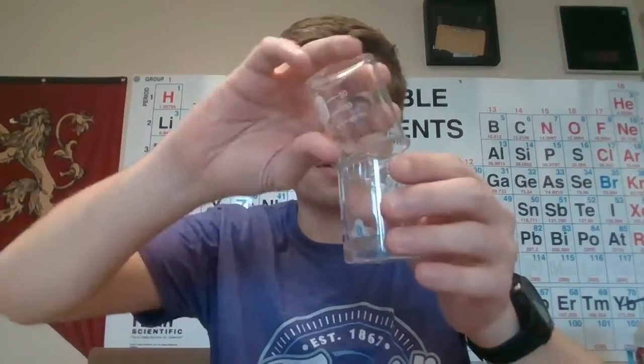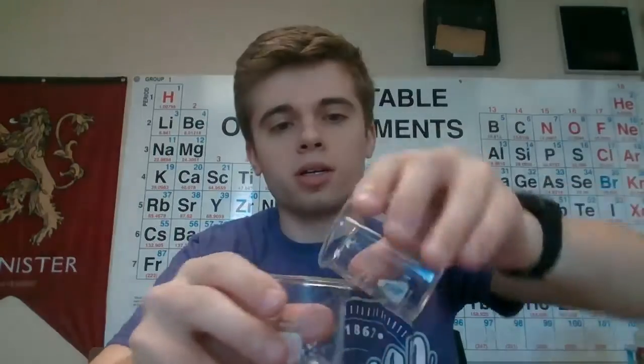Welcome back. We're going to do trial 3 now. This is at room temperature, which in here is right around 18 or 19 degrees Celsius. So it's probably not going to be a whole lot different than that 15 degrees Celsius, so make sure you're careful with your time. I'm mixing them now, so start those timers, and we'll see how long it takes to turn blue. There we go. So stop, record that time, and then come back for our last trial.